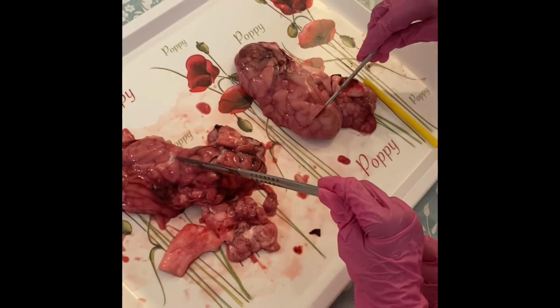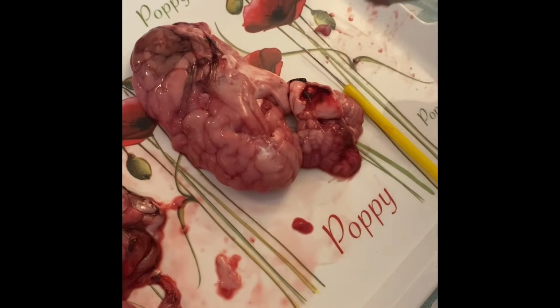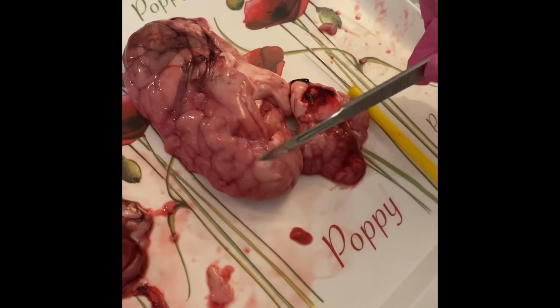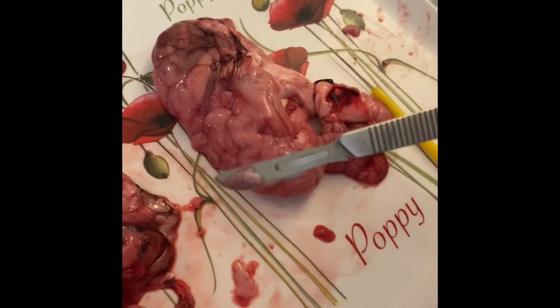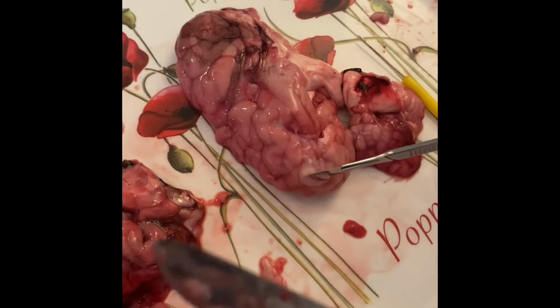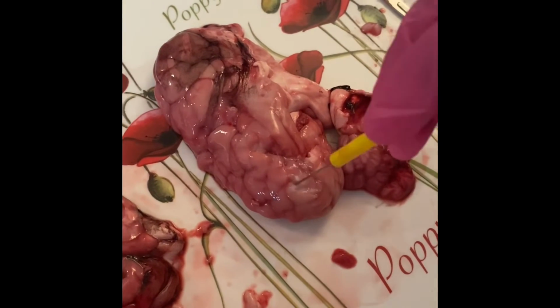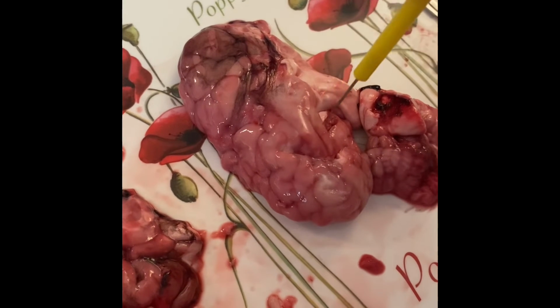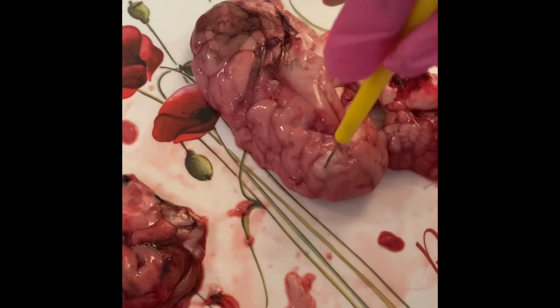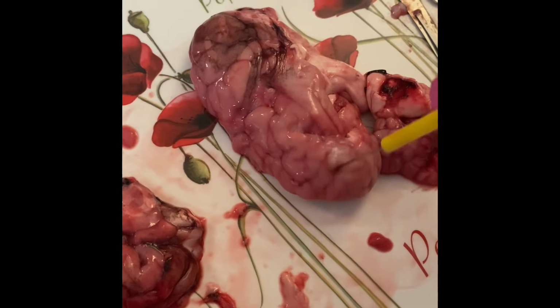I'll help you, my hands are clean. So Dr. Insia, what are you observing? What are you scraping the surface of? This procedure shows me that if I scrape off just a little bit of this top part, it leaves me the whitish greyish thing. Yes, but what's this wrinkly bit called? That's the cerebrum. Yes, this is the cerebrum. And do you have the entire brain, or are you playing with half a brain? Half a brain.